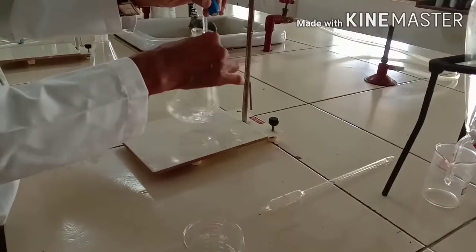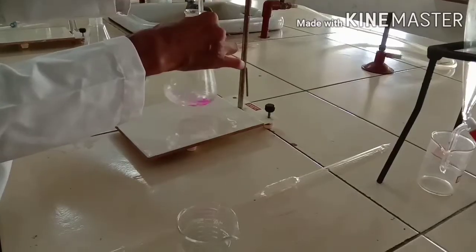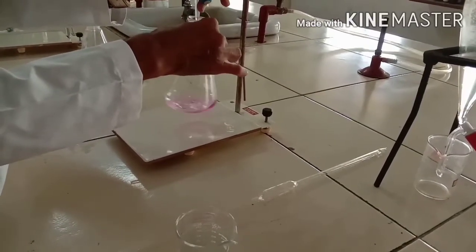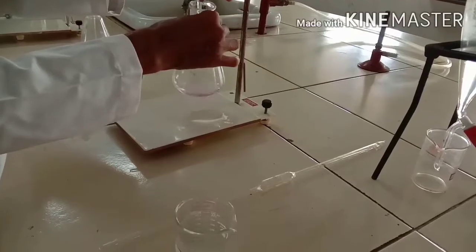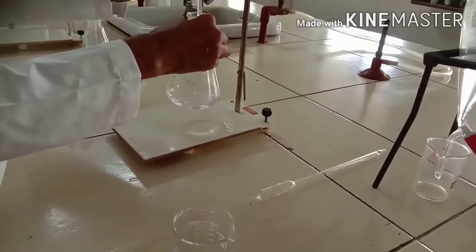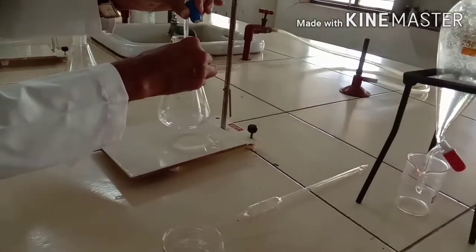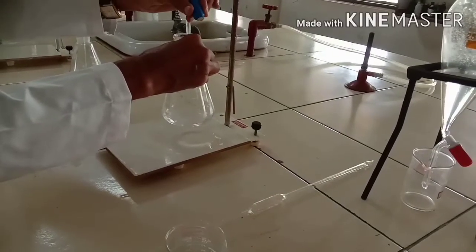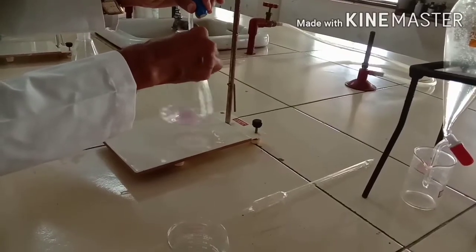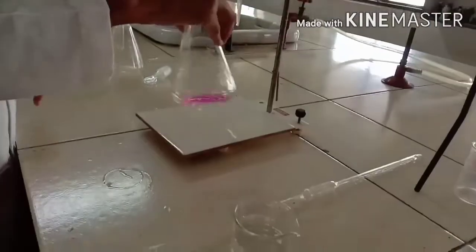We use 0.05 normal sodium hydroxide because the concentration of benzoic acid is less in the aqueous layer compared to the organic layer. In the organic layer, benzoic acid forms a dimer — two molecules of benzoic acid are associated. That is why the normal formula K = C_organic / C_aqueous is modified to the nth root of C_organic over C_aqueous, where n equals 2.